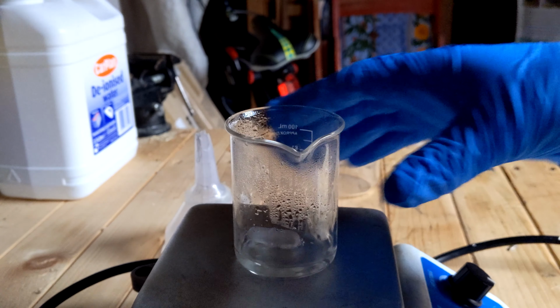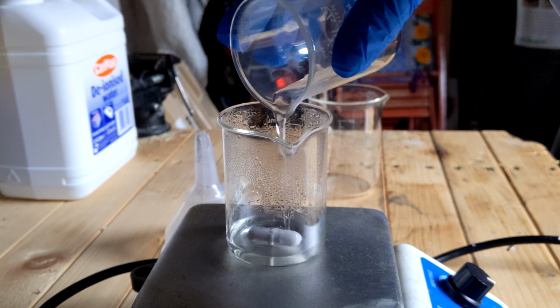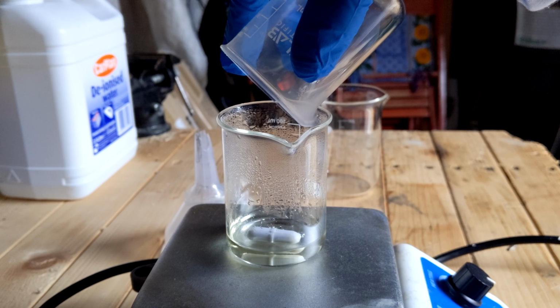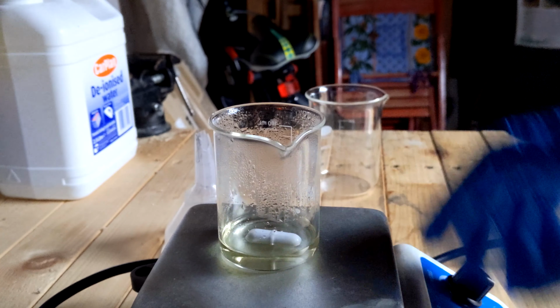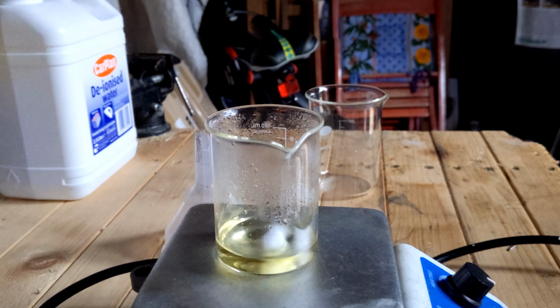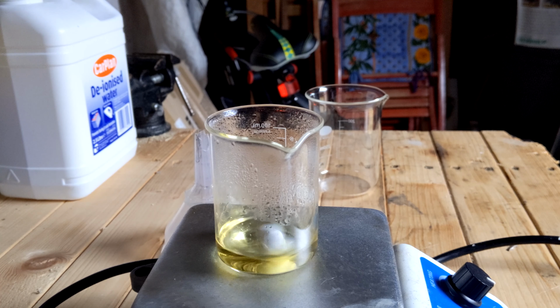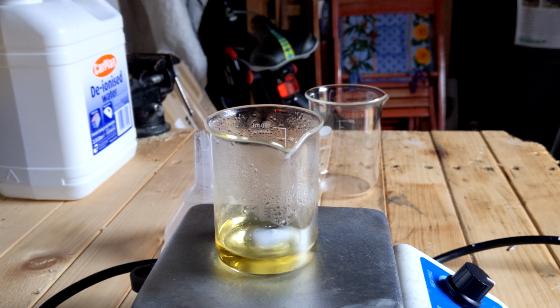Oh, the stir bar spazzed out. Yeah, you hear me cough from the fumes, the hydrogen chloride fumes. So add it in and you see the solution turns yellow very slightly. This is the hydrogen iodide being formed. Oh God! Yeah, I coughed again. And it goes yellow as the oxygen in the air starts oxidizing some of the iodide into iodine, which is slightly soluble in water, in fact. And then iodine dissolves quite well in an iodide solution, so there's iodine in there.